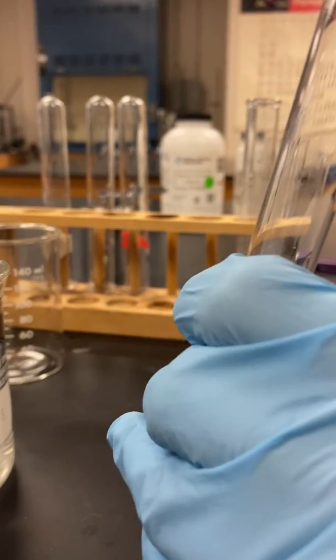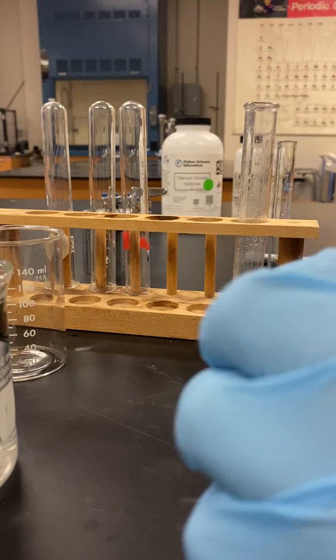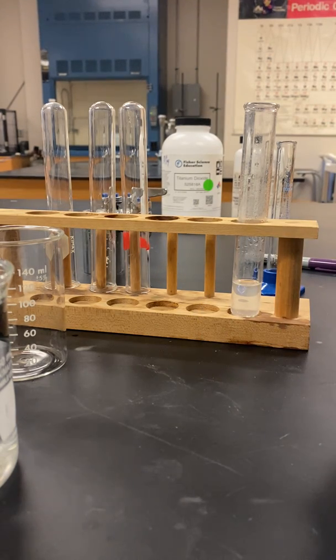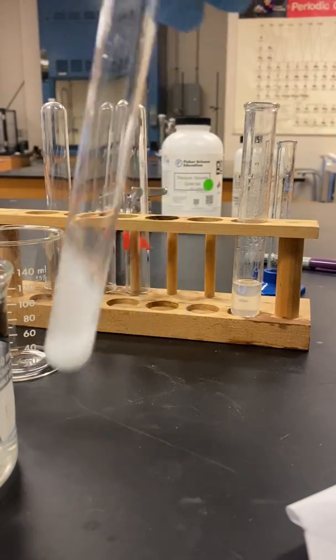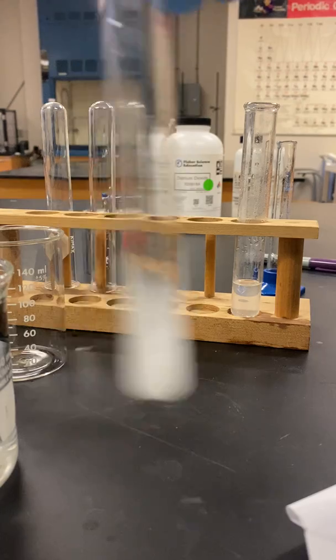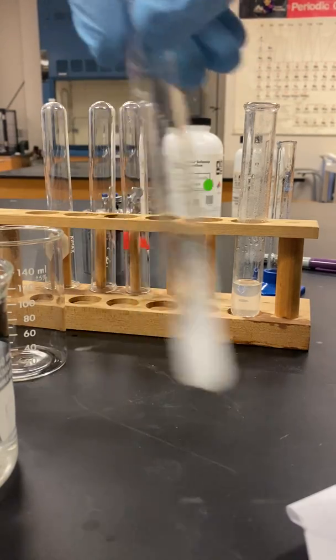So now once again, you'll need to tell me whether or not that's endothermic or exothermic. And so what it says to do now is completely dissolve the crystals in the warm water bath. You will need to swirl the mixture regularly. And then we're going to place this in an ice bath.